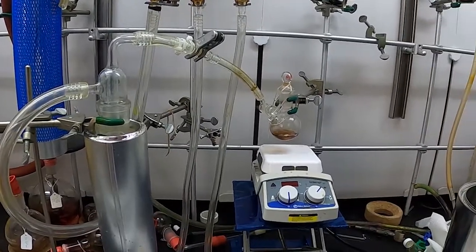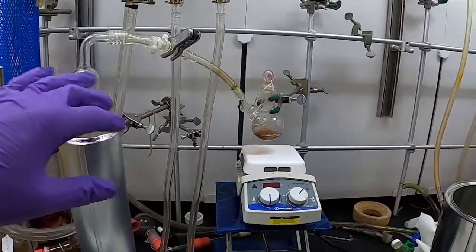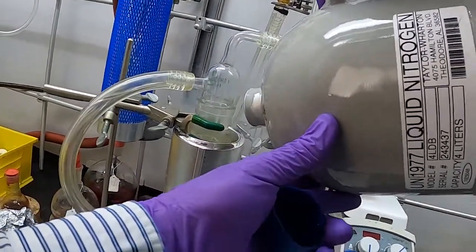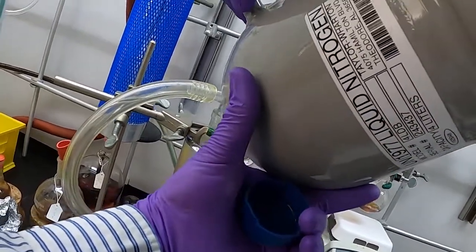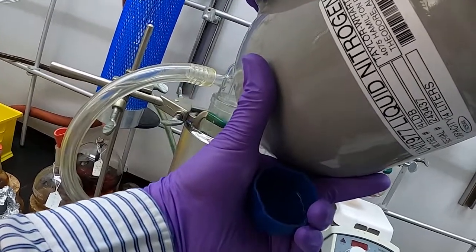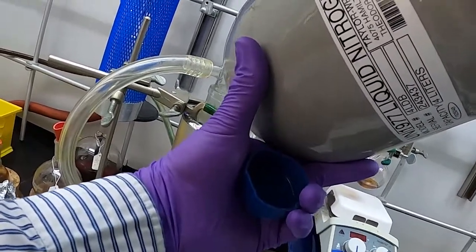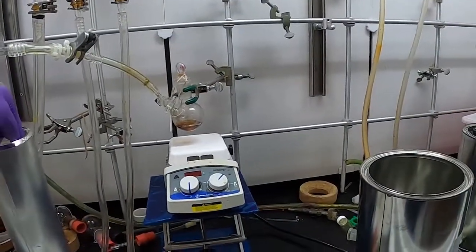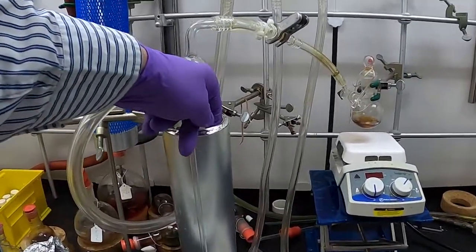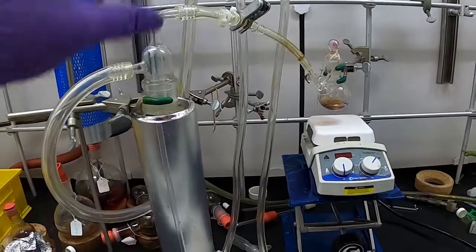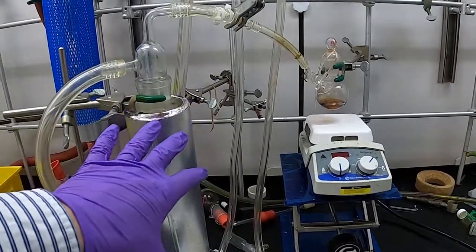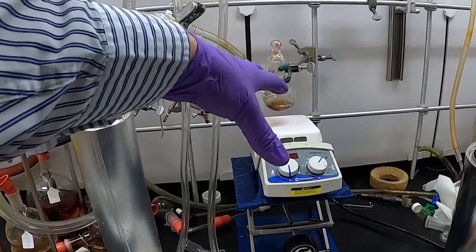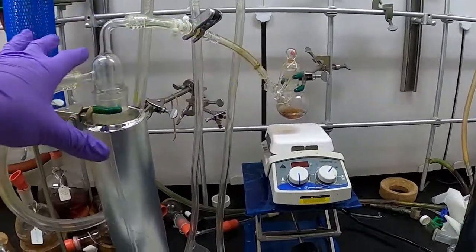Now that we have this all pumped down, we can add our liquid nitrogen cryogen. We have our Dewar, and we add that till it's roughly about here—till you can touch it within there briefly. You have that all full so you have enough liquid nitrogen to catch all the respective gases and everything that's pumping down and all the solvent being pumped down in that respective trap.